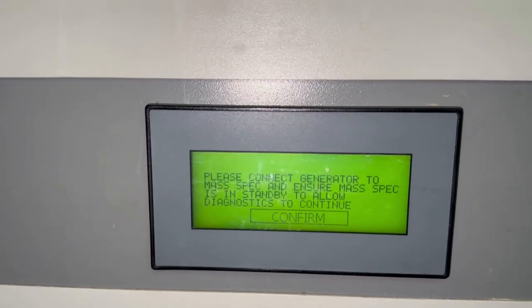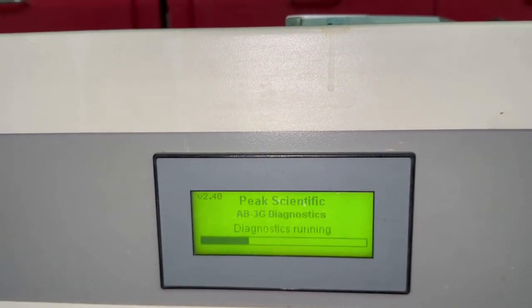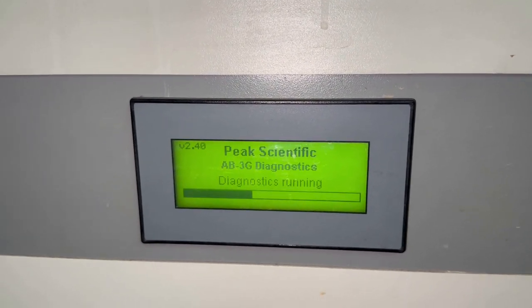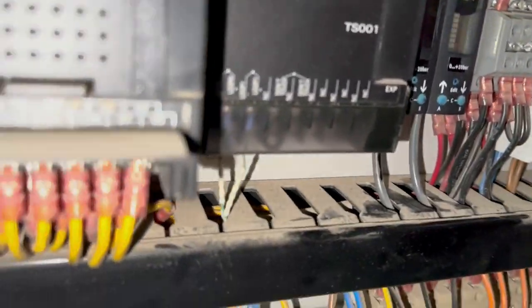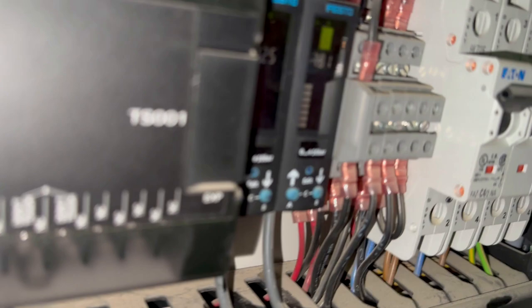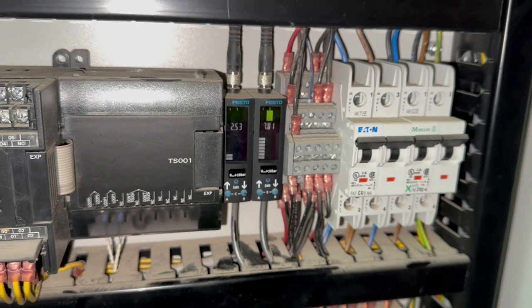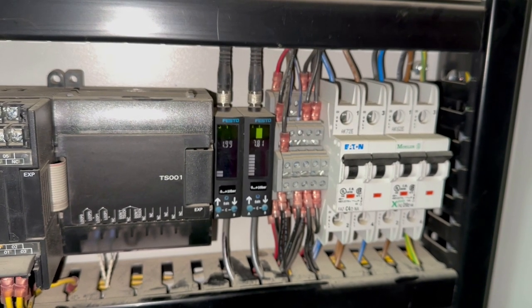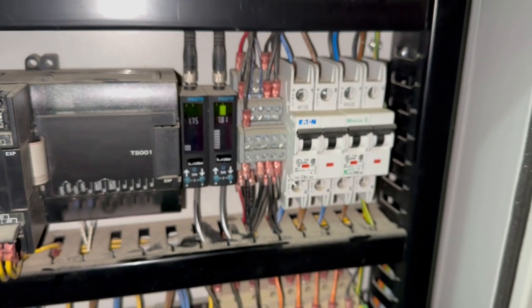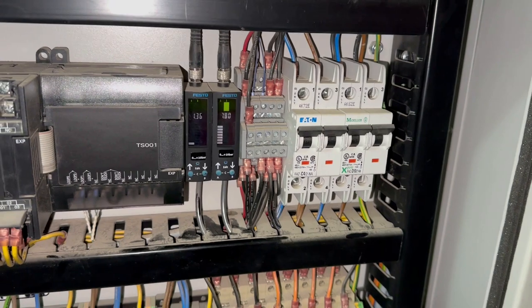That N2 shut off valves failure. So it means it's giving us some error. So let's first confirm and then let's see. Again in the diagnostic mode.